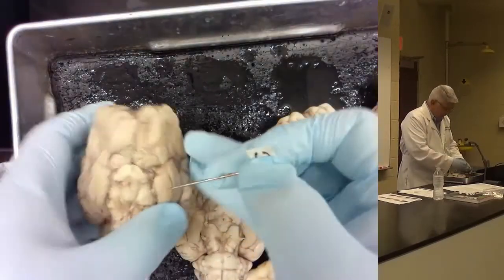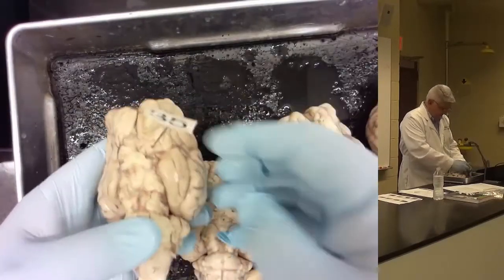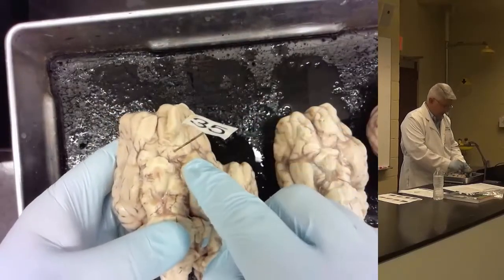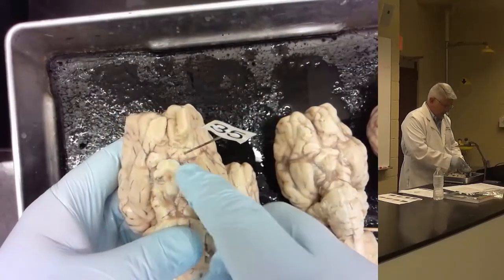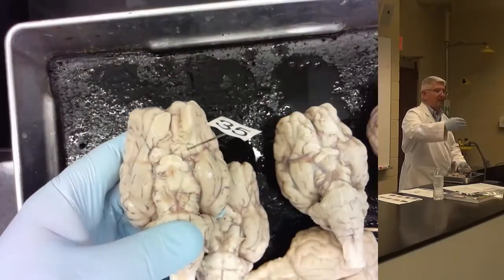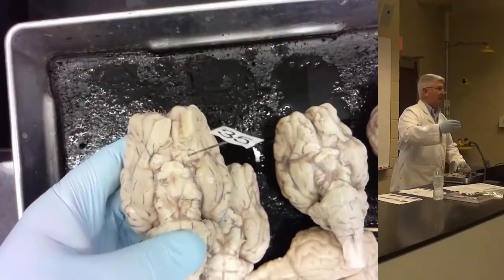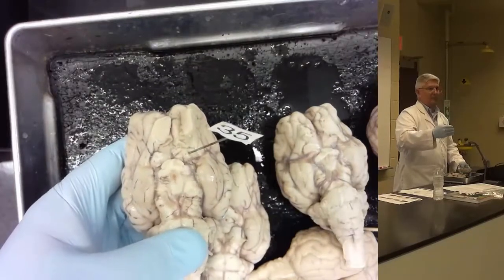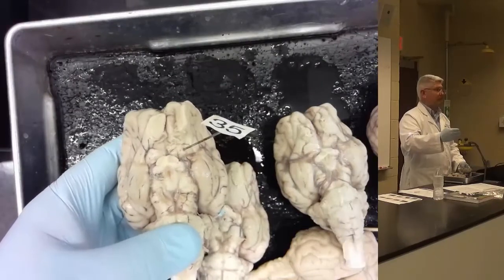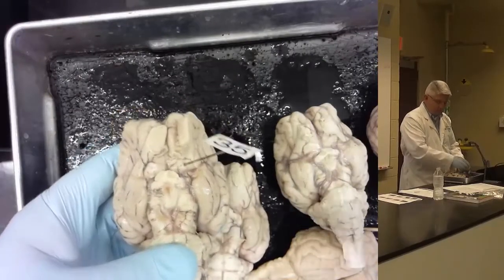And so that, again, would be marked with the boundaries of the olfactory nerve, the hippocampal gyrus, the optic nerve, and the longitudinal fissure, that part that's in front, anterior to the optic nerve and the hippocampus. What was it called? The anterior perforated substance. Okay?